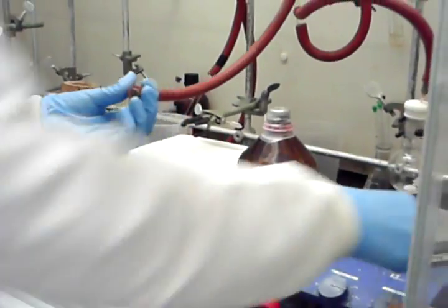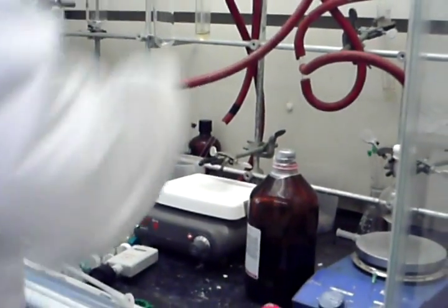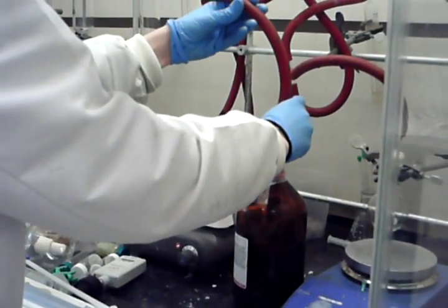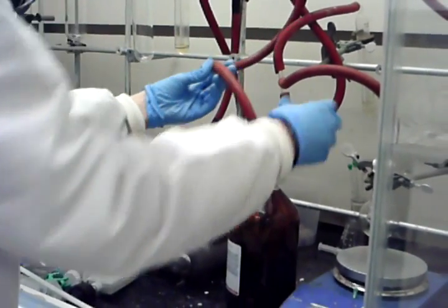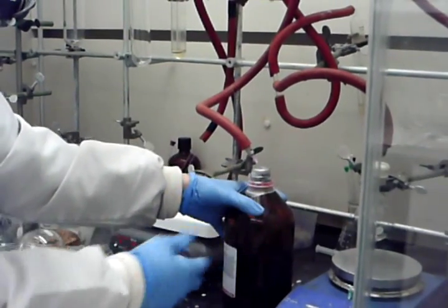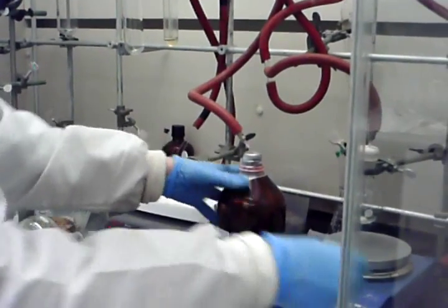Because when you pull with a syringe you're creating a vacuum, you need to have a nitrogen inlet to replace the liquid you're taking out. Make sure it's not clogged. Poke into a place that already has a hole and simply insert the needle in. Now the bottle's under pressure. Because this is such a large bottle, it's heavy enough that it doesn't need to be stabilized, but you do want to use a clamp or a metal weight.